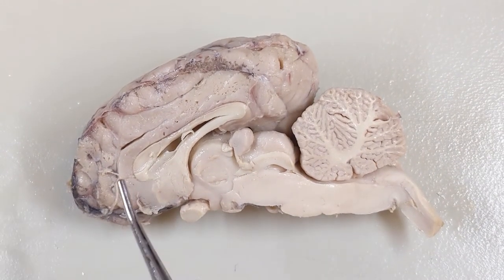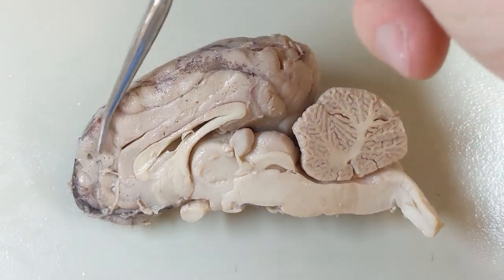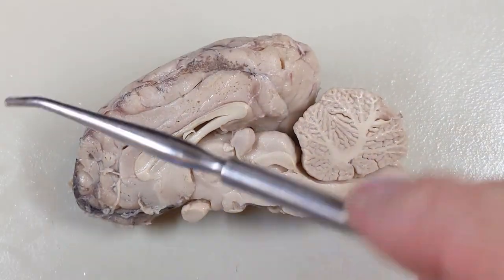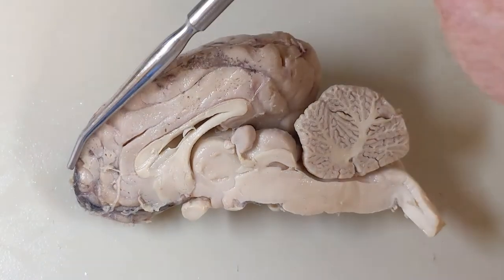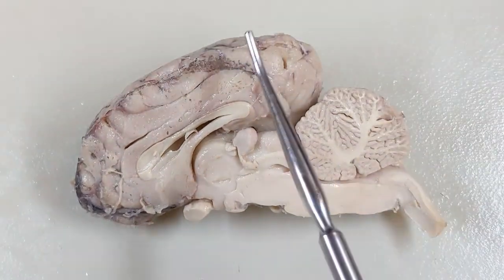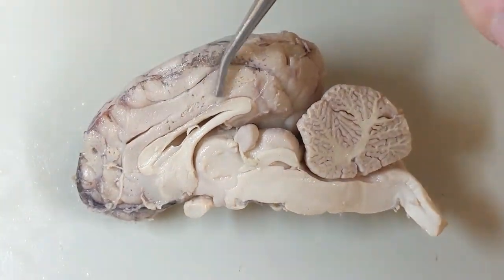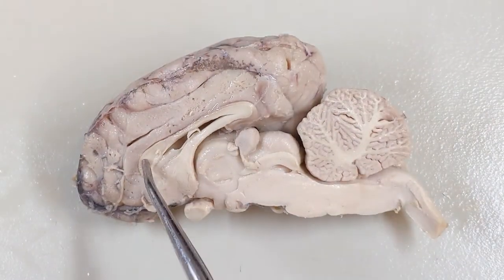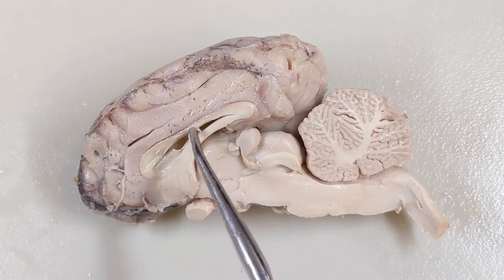Here we have a mid-sagittal view of the sheep brain. I cut right down the midline. First thing I did was stick my knife right into the longitudinal fissure and cut downward, but I didn't actually cut anything because the longitudinal fissure is pretty deep. I didn't cut anything until I got to this structure here, which is the corpus callosum.